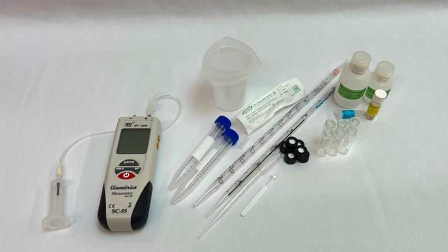Here we have everything that is provided with the kit. We provide you with enough reagents to run a total of 10 tests. If you want to run all 10 tests at the same time, you will need to purchase additional reaction vials and septicaps, which are available on our website.